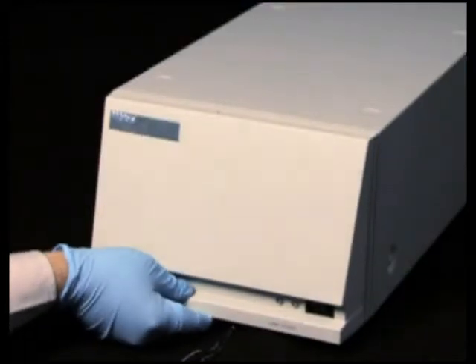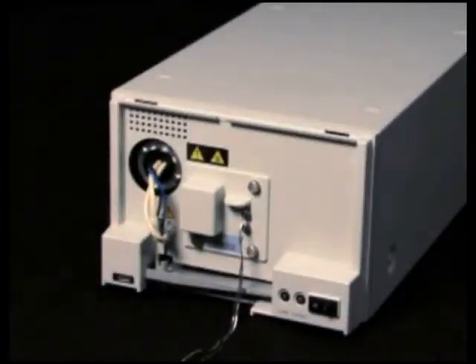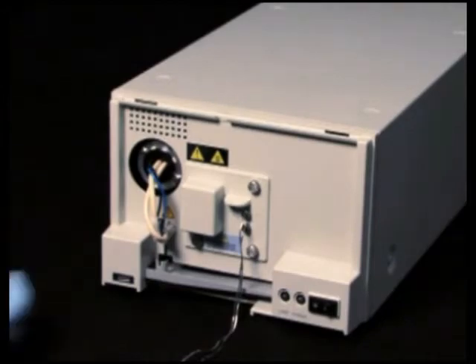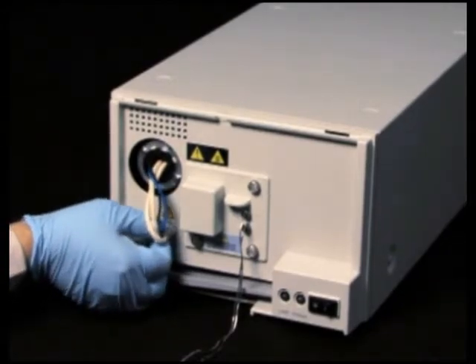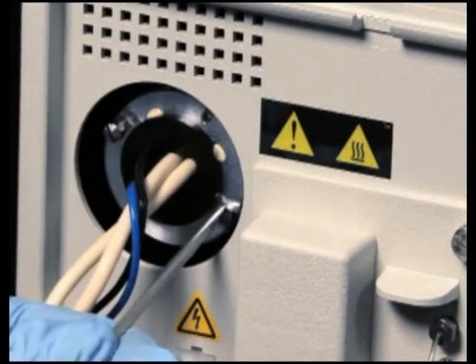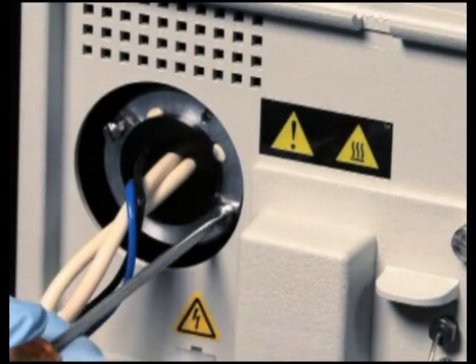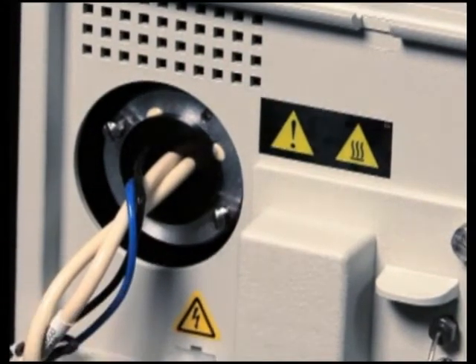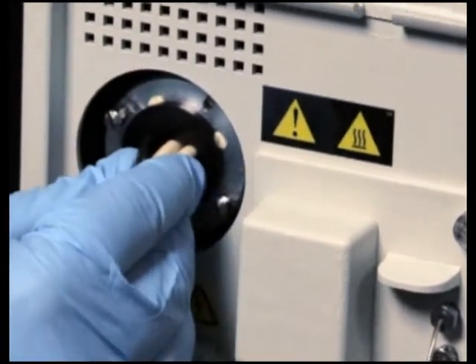Lift up the detector front cover and pull it away from the detector chassis. Disconnect the lamp's power connector. Use a flat blade screwdriver to loosen the two captive screws in the lamp base. Gently withdraw the lamp from the lamp housing.